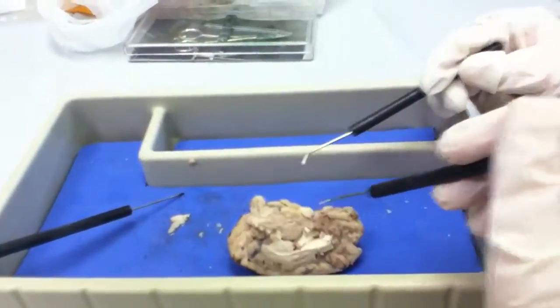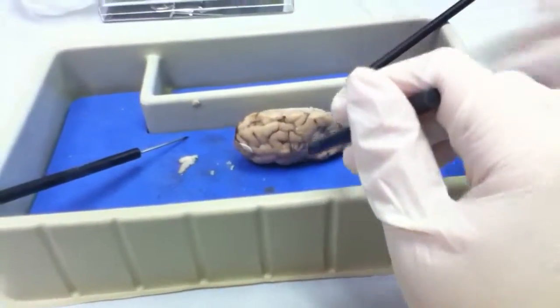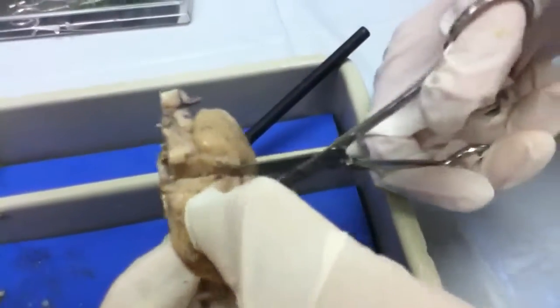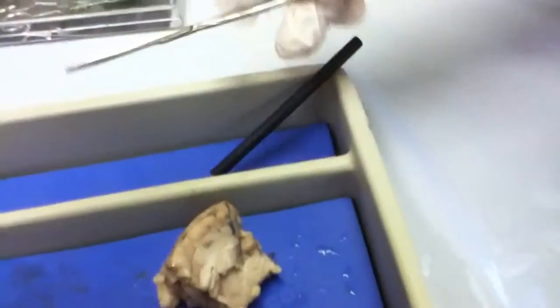Take your scissors and cut not lengthways but crossways — cut the brain in half. Go for it. I'm gonna cut my gloves. Oh, that is so cool. This is so much fun. Ew, brain? Did you just say that? Okay, that's not very easy. So everybody has their own piece now. You got the optic nerve — not fair. Your sheep can't see. Pick it up, hold it in your hands. You can get the consistency and squishiness of it. Don't squeeze it too tight because you're breaking pieces. Still looks like cauliflower.